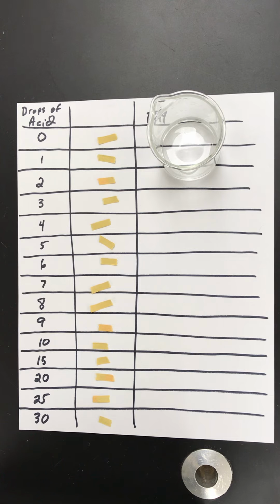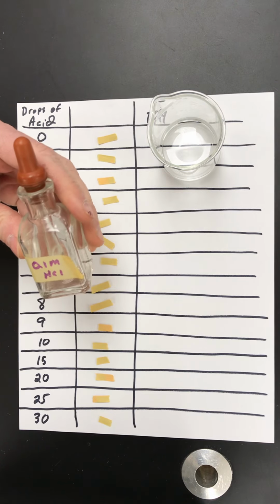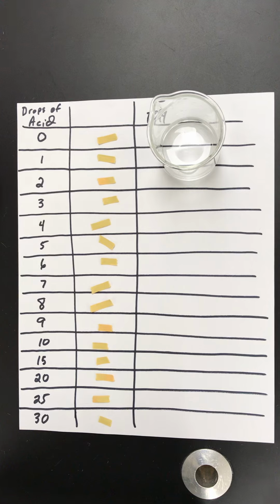What I'm going to do here is demonstrate how the acid-base buffer lab procedure was done. We're going to test solution X. In the beaker is 20 milliliters of solution X. We're going to add drops of pH 1 hydrochloric acid to solution X and see how the pH changes. Eventually you'll compare that to the pH changes of other solutions that you'll be given the data for.